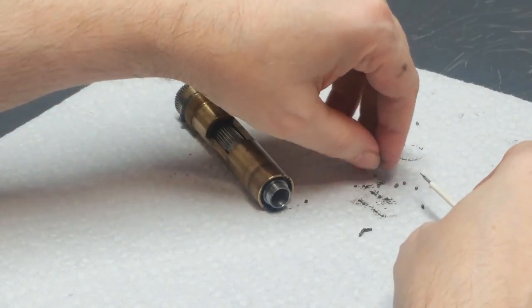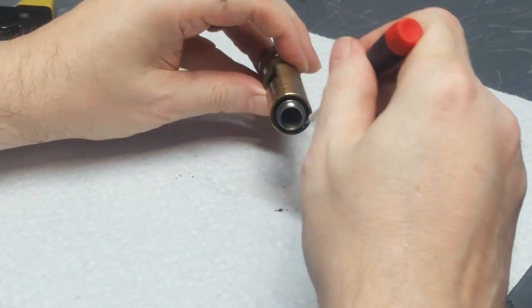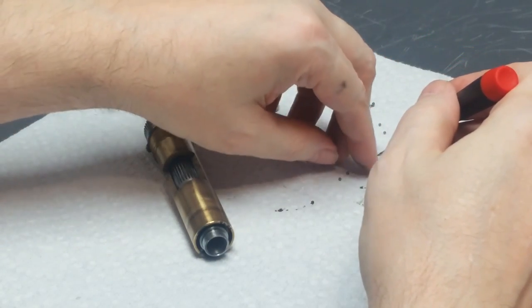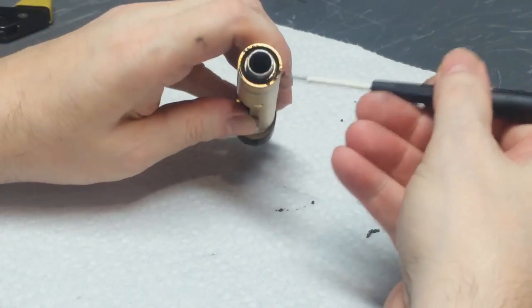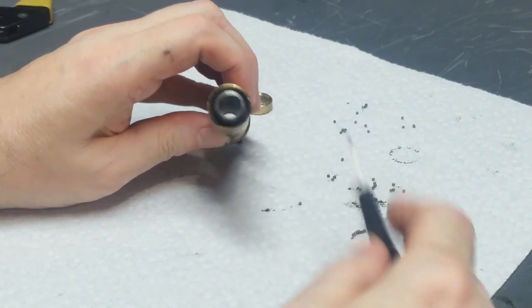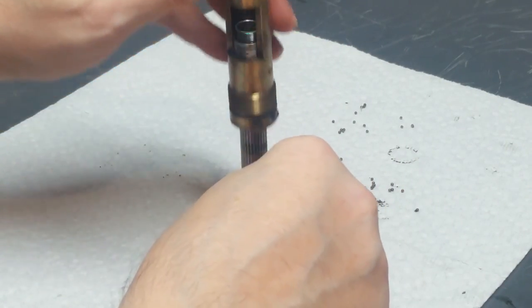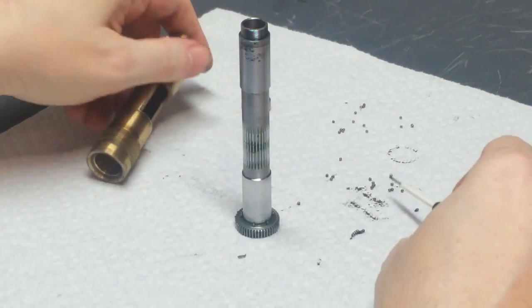But if you don't have access to that, if you don't want to have to go through the whole thing of ordering them, I suggest you just disassemble this whole thing over some kind of a catch pan so that you have a good chance of catching all these and not losing them. So now there ought to be 30 of them that were in this end are out. There's still some balls on this end.